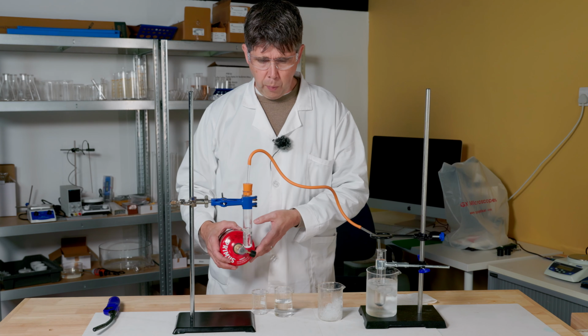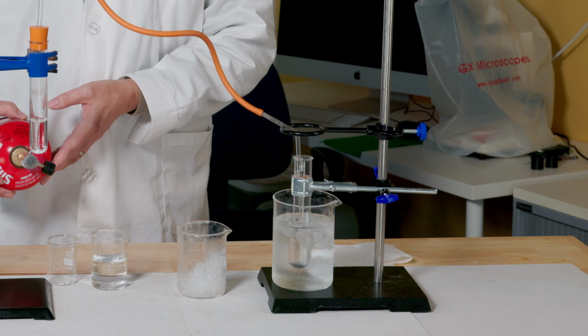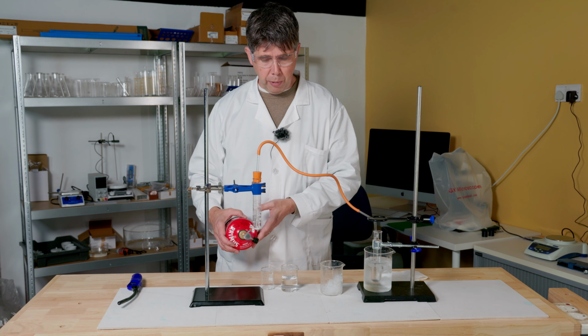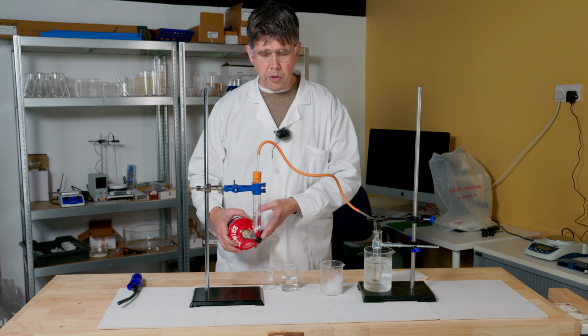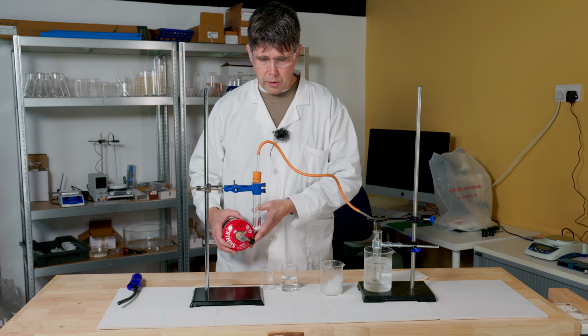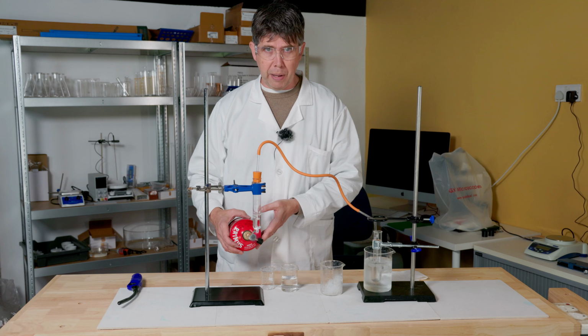At no point do I want those bubbles to rise up too high, because that could cause bubbles of the mixture to get into my tubing, and that would contaminate my distillate at the other end. And rather like in the evaporation experiment in the previous video, I do have to continuously adjust the position of this flame. Too hot, and my water will boil too violently. Not hot enough, and once again we'll be here all day.